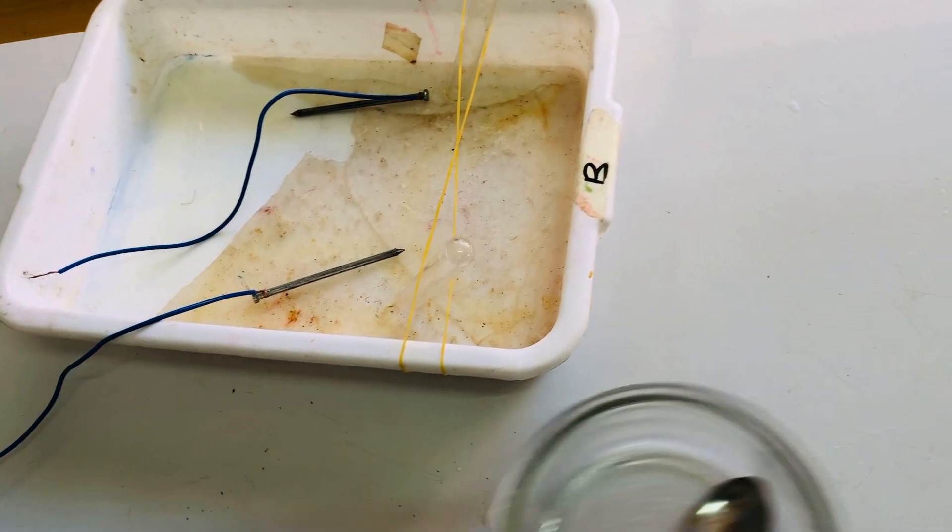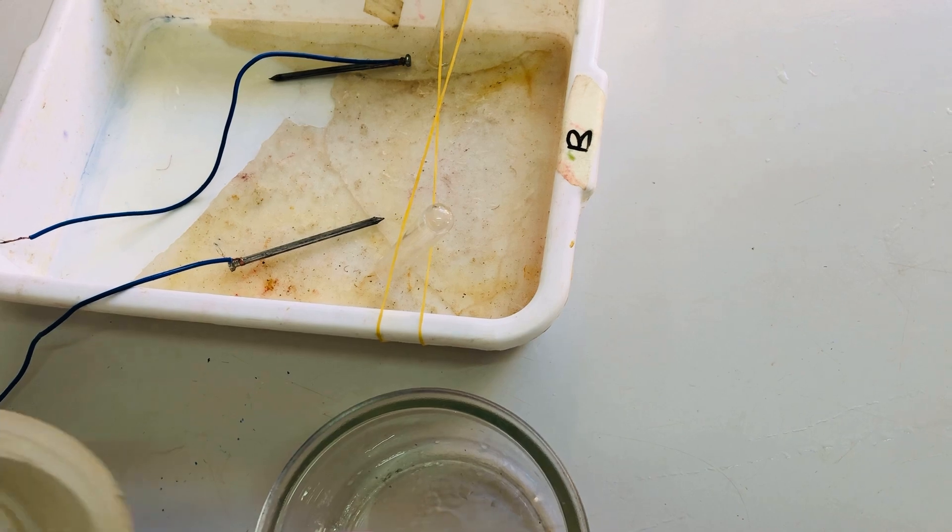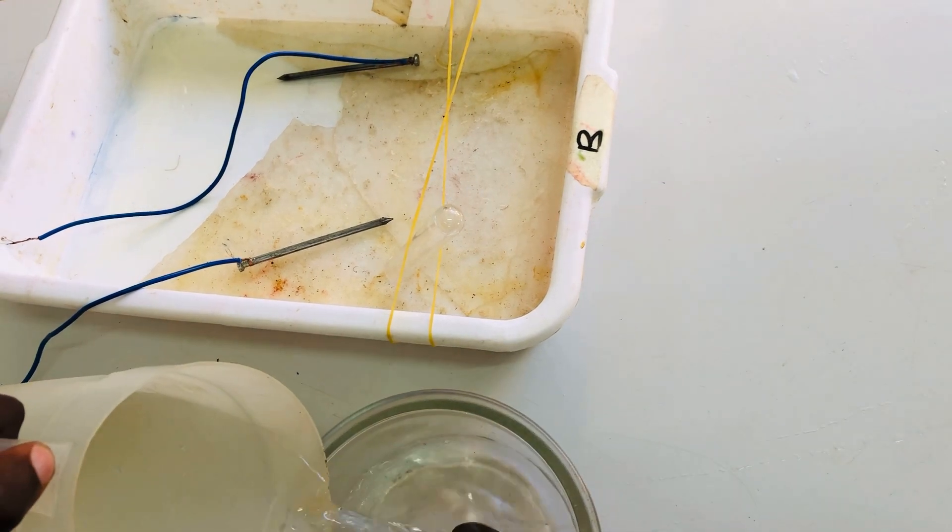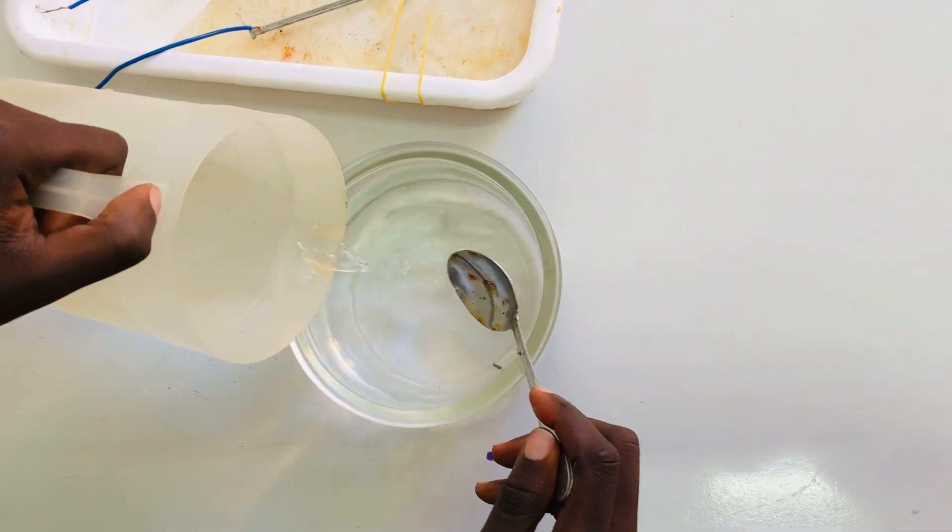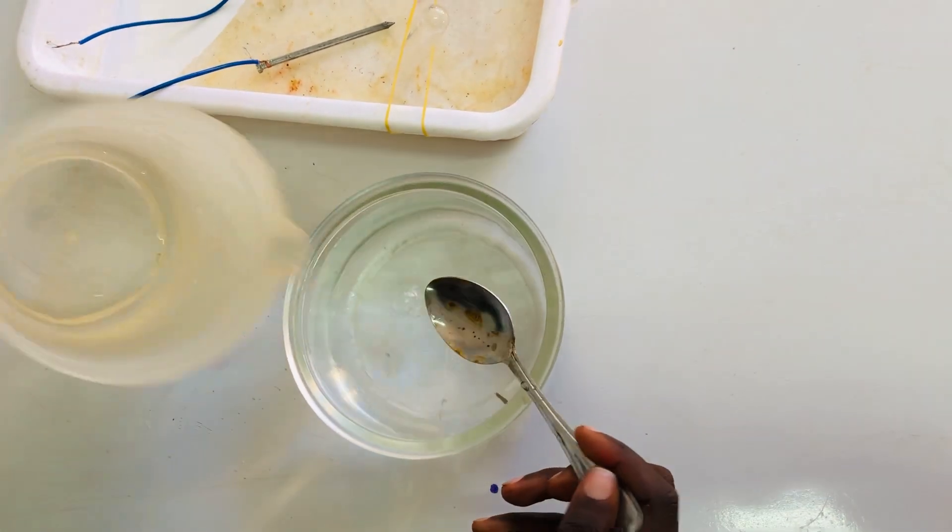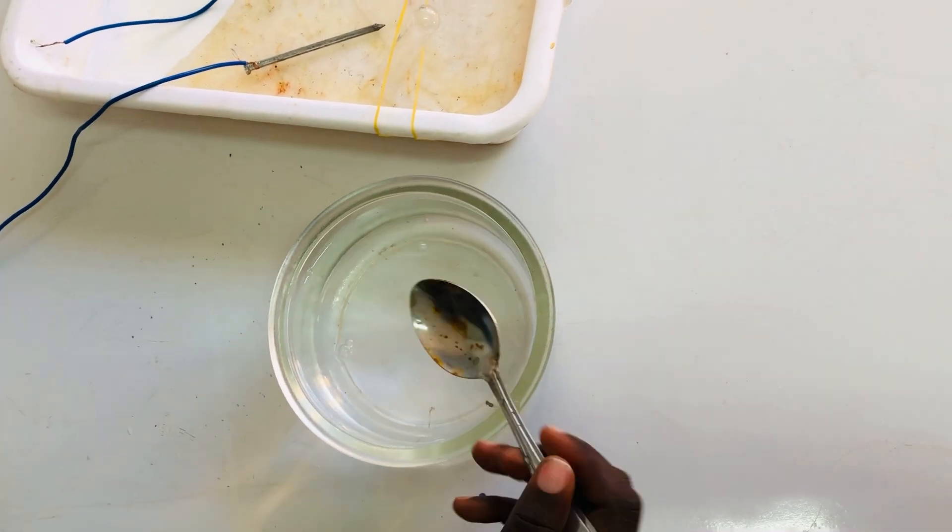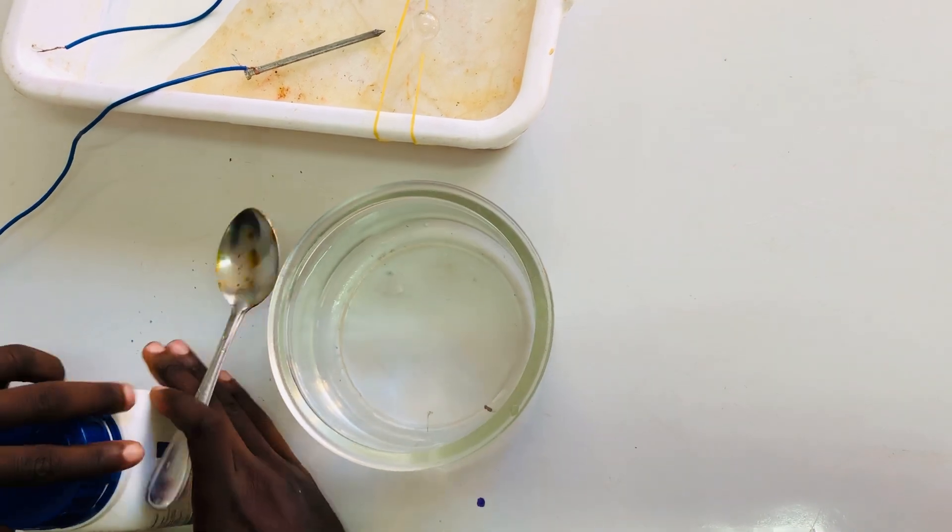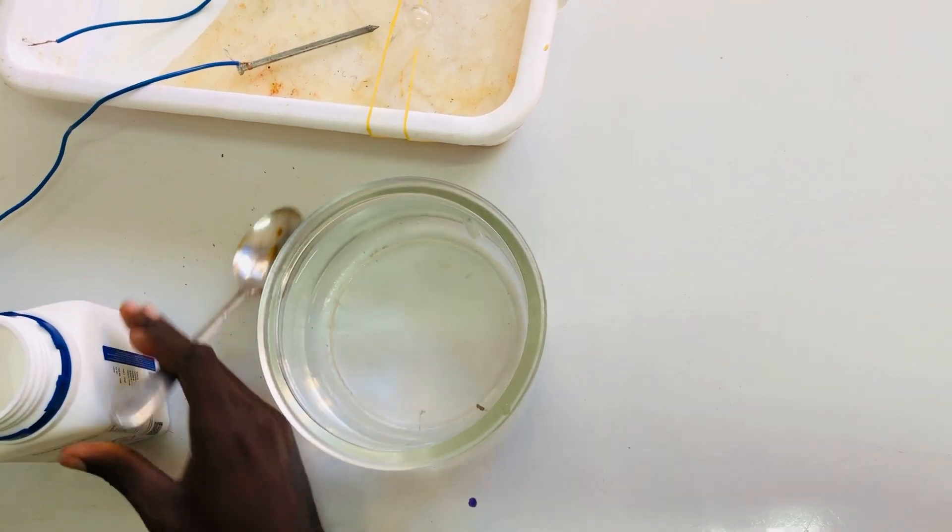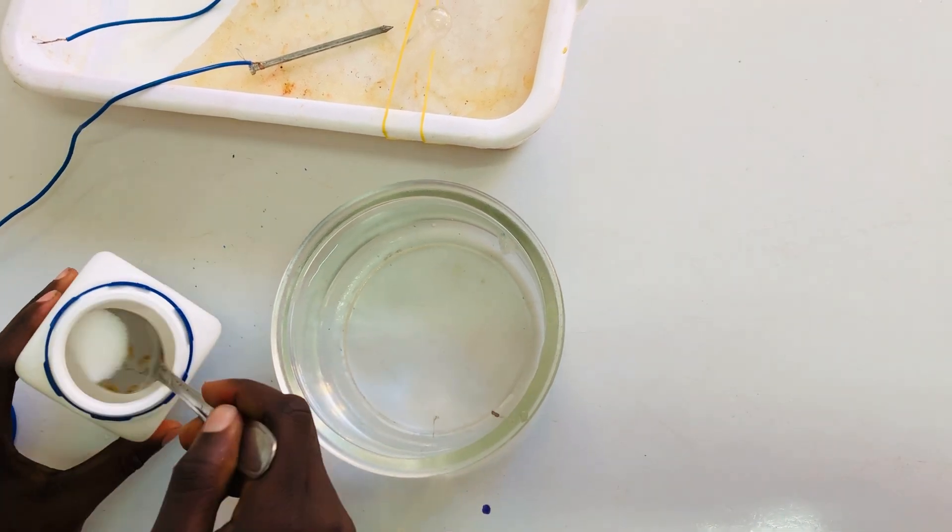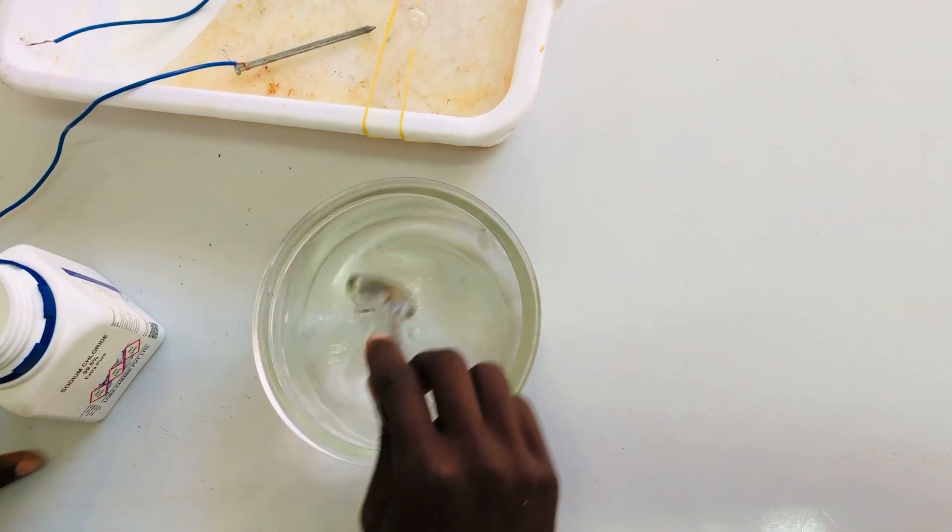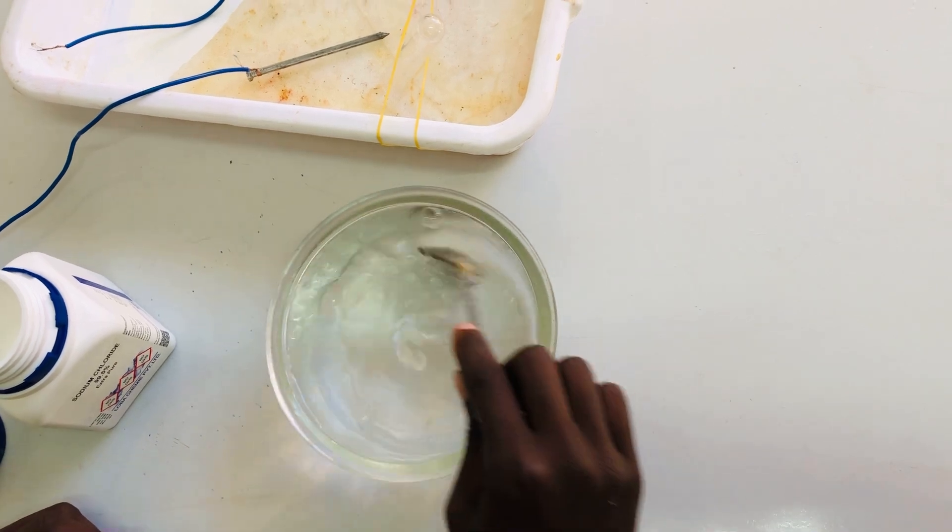Then after, we have to take water. But we say that water is a bad conductor of current, so we need to take some salts. This is a salt of sodium chloride. Make sure you dissolve it.